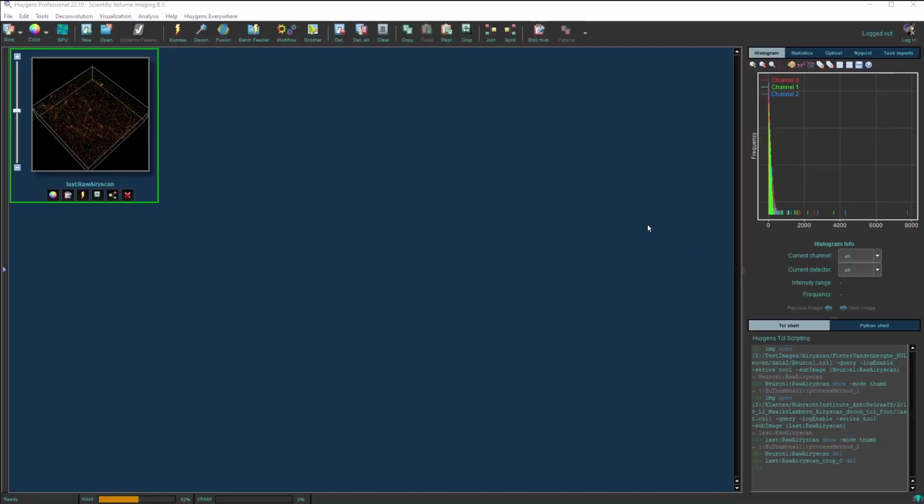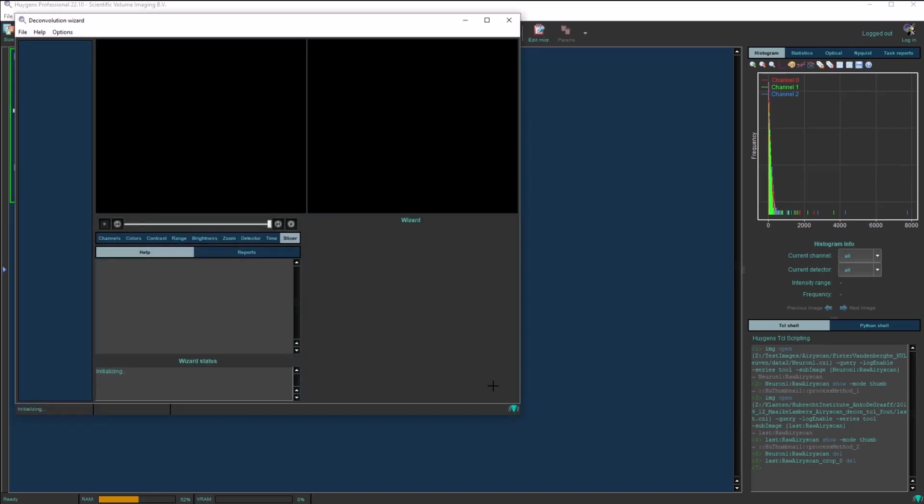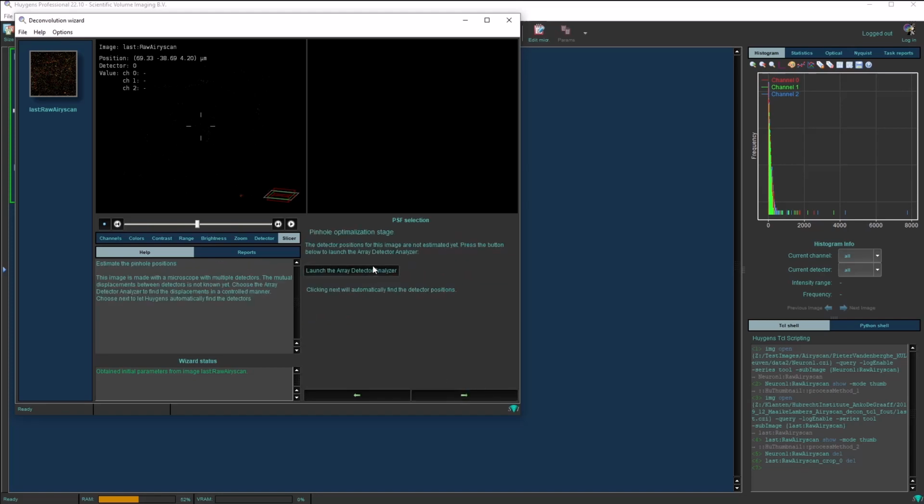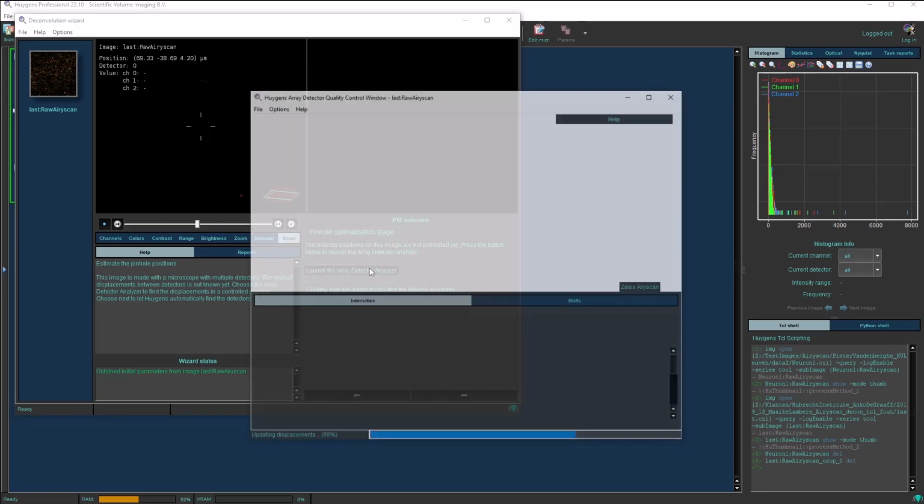So here we have another image sent to us by one of our customers, and from visualizing you can see very faint details of structures, but after deconvolution this does not get resolved properly, and by using our new Array Detector quality control tool we can see what might have gone wrong with the acquisition of this image. So the deconvolution wizard takes quite a while to load on this large image, but we can click on the Array Detector Analyzer tool again, and it will then open.